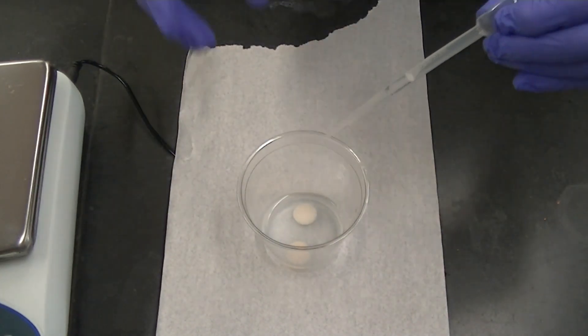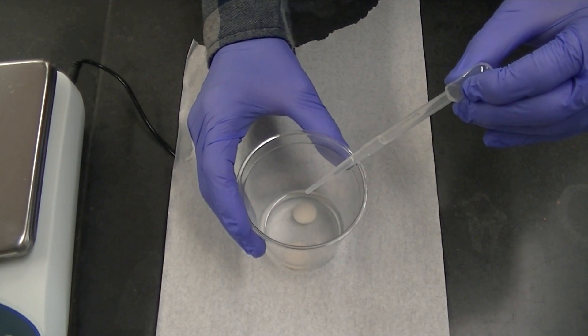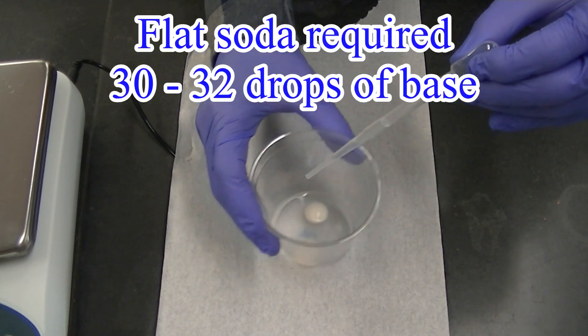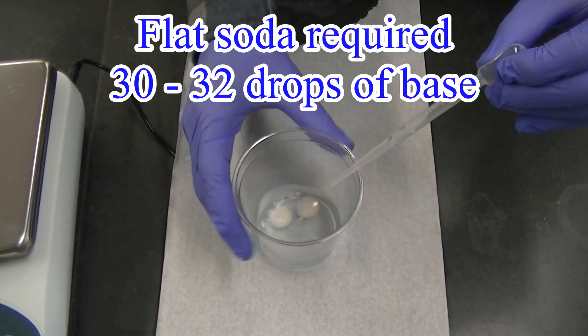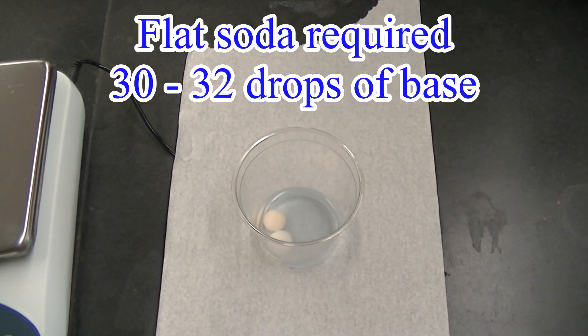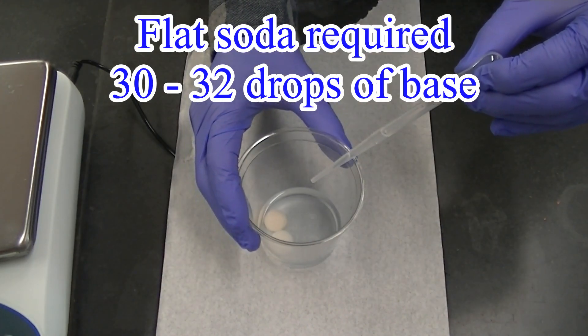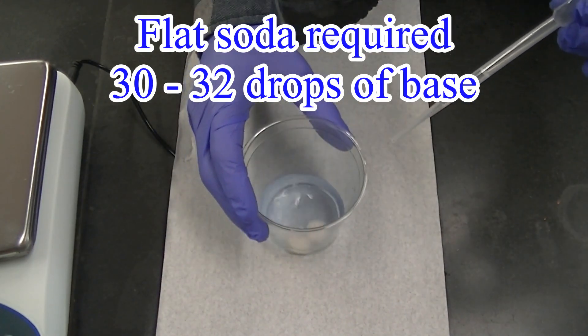Oh, that looks like it's persisting. Maybe one or two more drops. Let's see. I think that's it. A few more drops just to be sure. Sure enough.